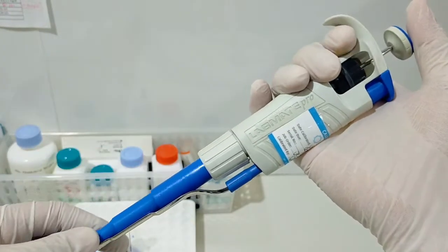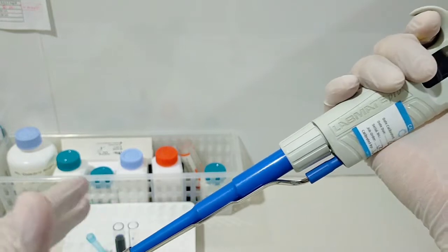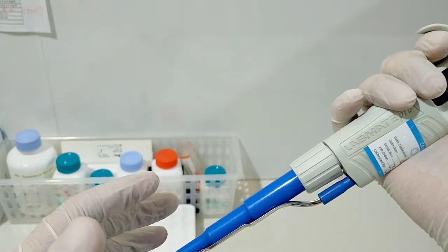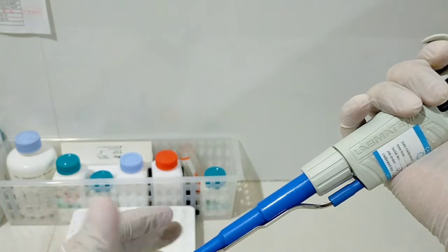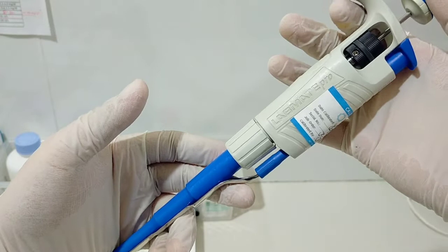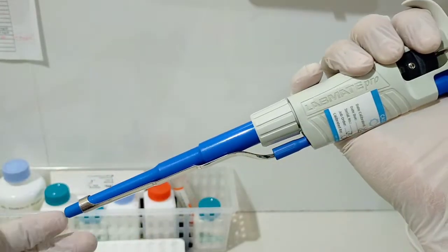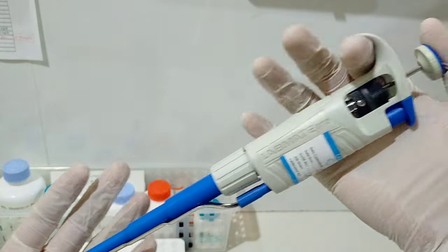In addition to our previous topic discussion on the pipetting exercise, I am presenting to you an additional pre-recorded video presentation to help you visualize better the pipetting steps that we are referring to. So basically, this is an example of an automatic pipette, an air displacement automatic pipette. Let us begin by introducing you to the basic parts of an automatic pipette.